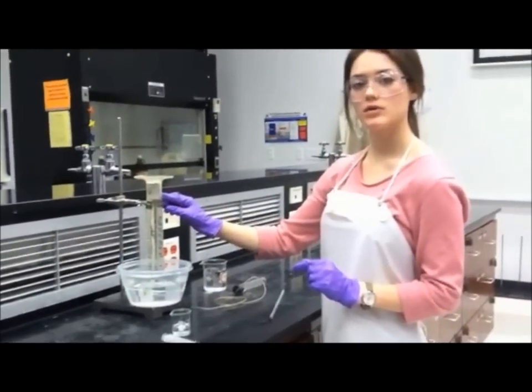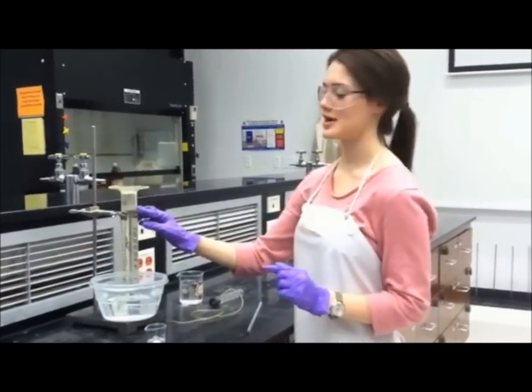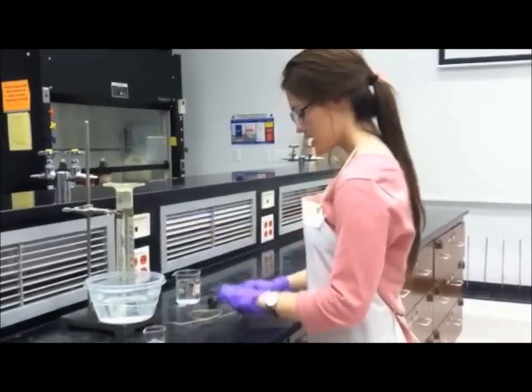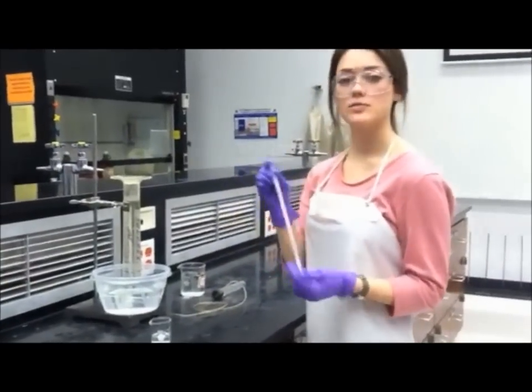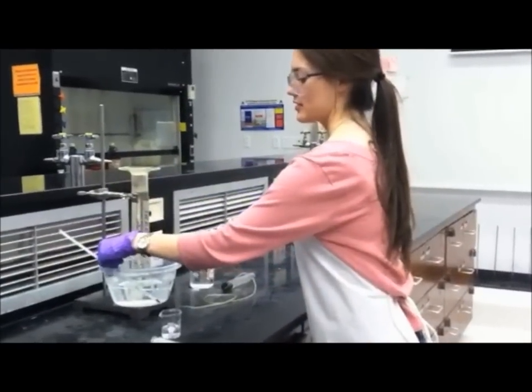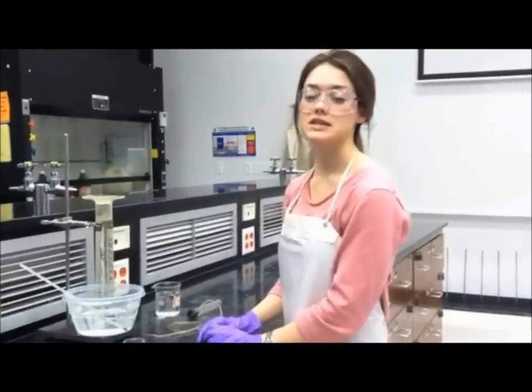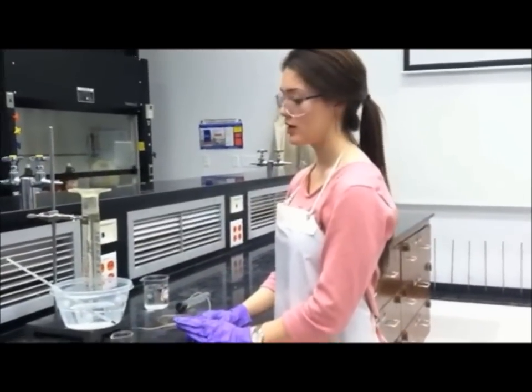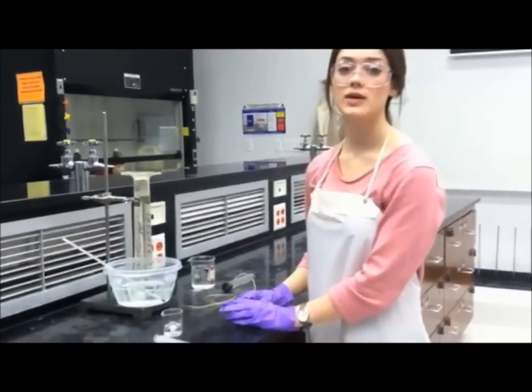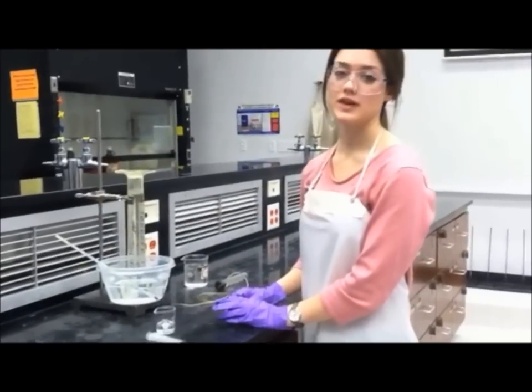We're going to show you the one with the air bubble because you need a little extra work, but don't worry, it won't take too long. And now, also put in the thermometer to take the temperature of the water bath. Don't forget to do this each and every time you do a trial because the temperature can fluctuate and it could give inaccurate results if you forget.